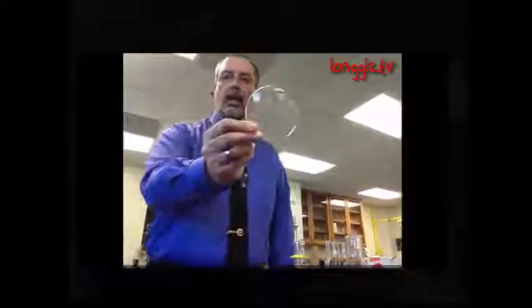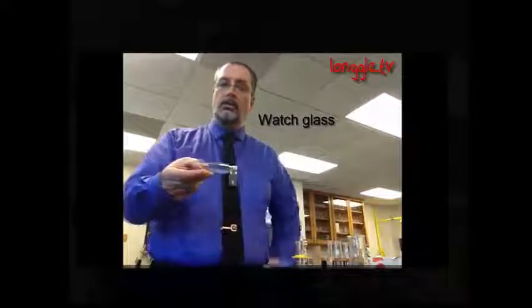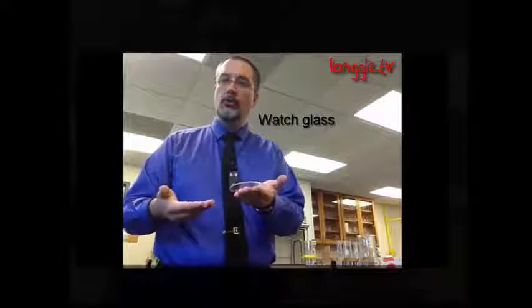This looks like a giant contact lens. It is in fact called a watch glass, and we can put something on there to observe it. We don't ever heat a watch glass. Be very careful. Sometimes you might want to heat this. Don't heat this. The Pyrex that it's made out of is pretty fragile, and it'll crack if you try to heat it.